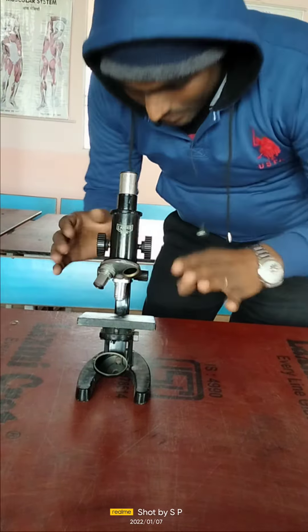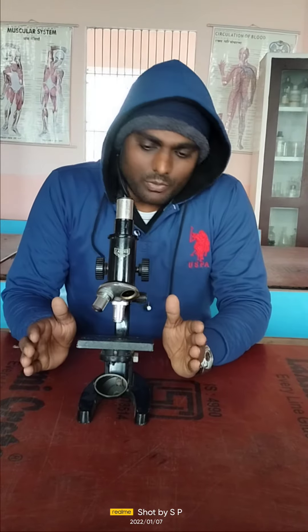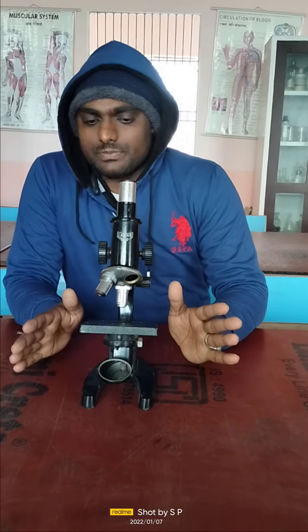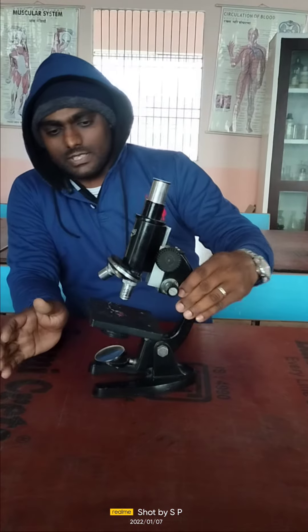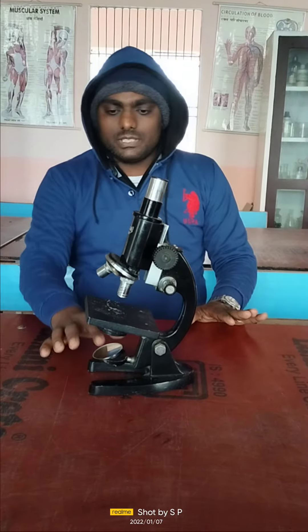One major thing: once it is fixed, it should not be disturbed, otherwise the observation of the specimen may get disturbed. This is the compound microscope — this is the mirror which is used to focus the light on the specimen.